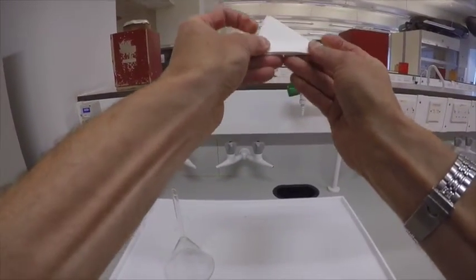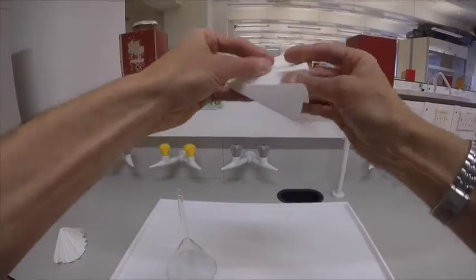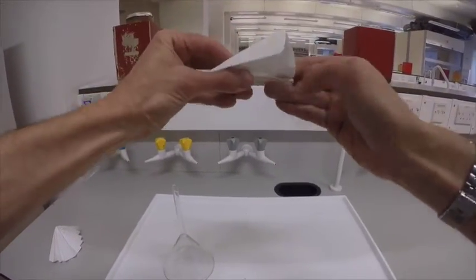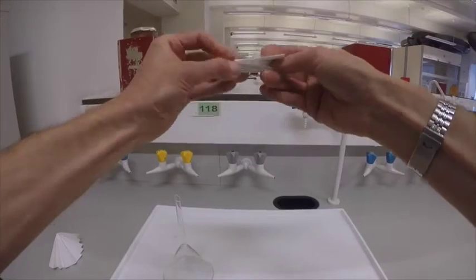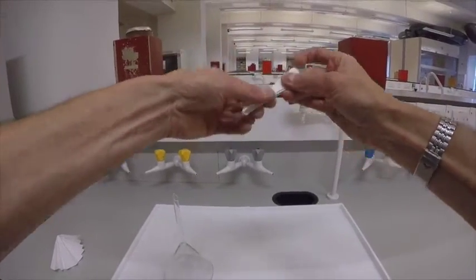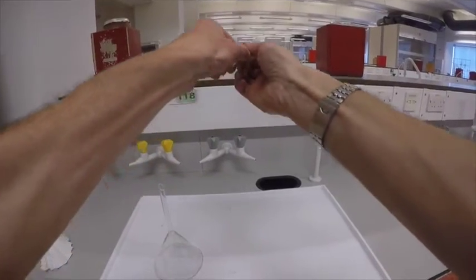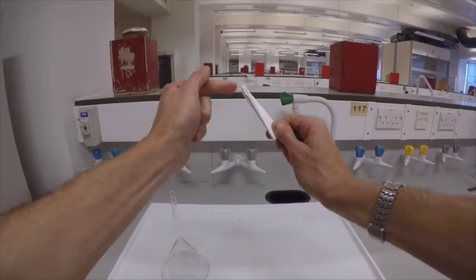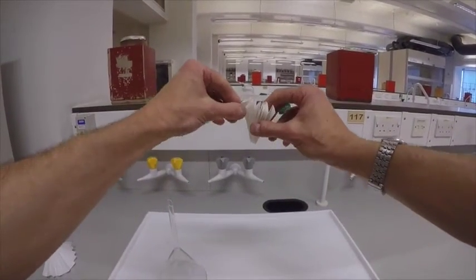As we do so, the filter paper is getting more and more nicely pleated. It's folded back on itself over and over. You want to work the edges of the folds nicely, but don't work the tip too much — if you do that, you risk weakening the filter paper.